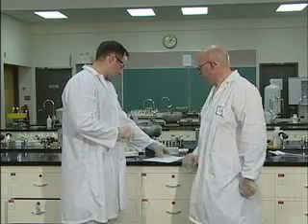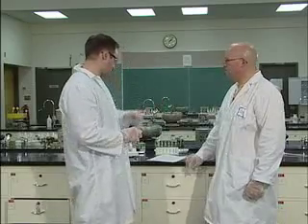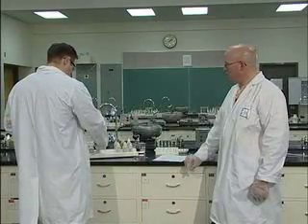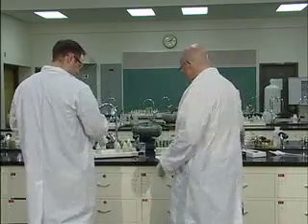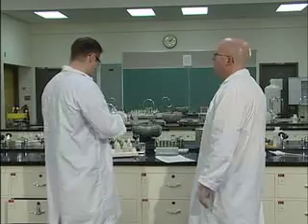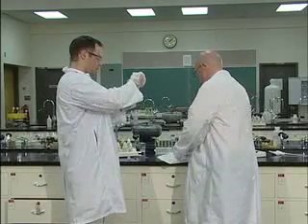Okay, good. So the last step is D. Now we'll go through this one start to finish because it's a little bit more tricky than the other ones. So into D, you're going to put in 30 drops of sodium carbonate. So this is our double reaction. It's a two-stepper, both double replacement reactions. Exactly. This is a two-step double replacement reaction.